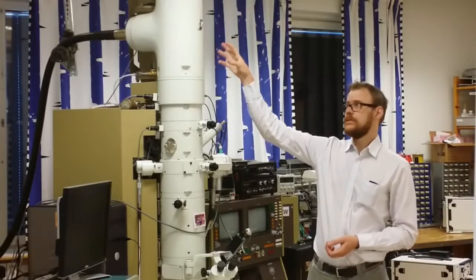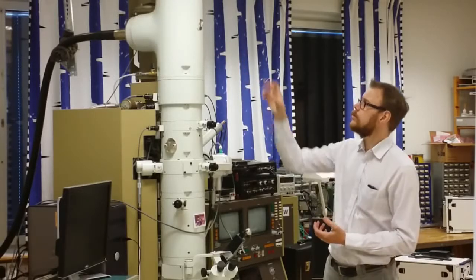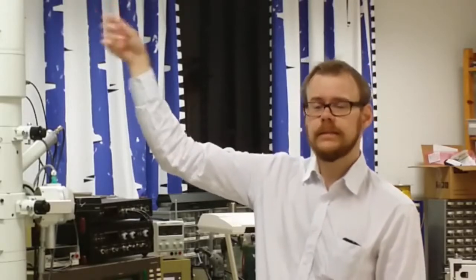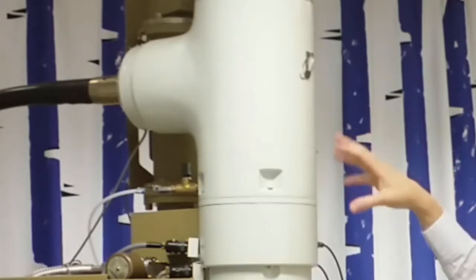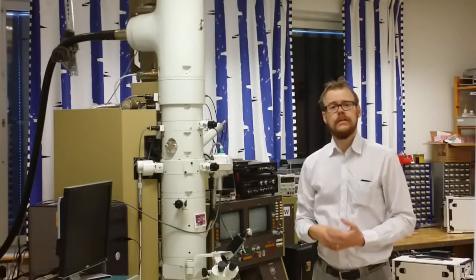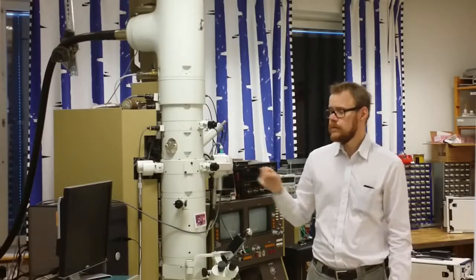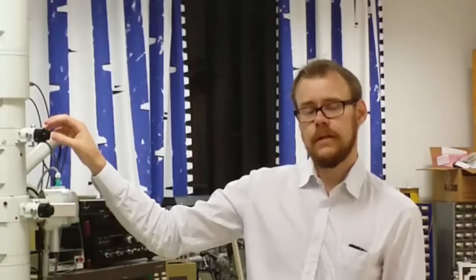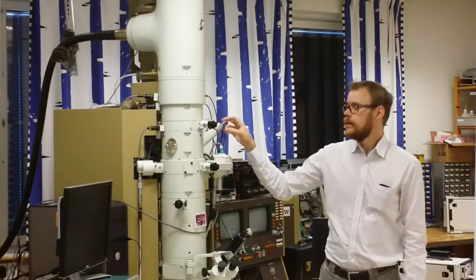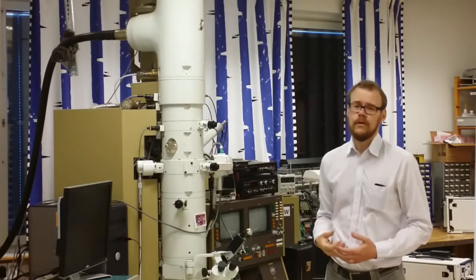The electron source at the top here in this particular microscope is of thermionic type. That means that the electrons are generated by heating a filament. Thereafter the electrons are accelerated in this gun section, and the accelerating voltage in this system is between 80 kilovolts and 200 kilovolts. If you have thick samples that are sort of hard to penetrate, you need to have a higher voltage. These three knobs are apertures. And the first one is a condenser aperture where you choose the size of the beam. If you use a small spot size of the beam, then you lose intensity, but you also increase resolution.